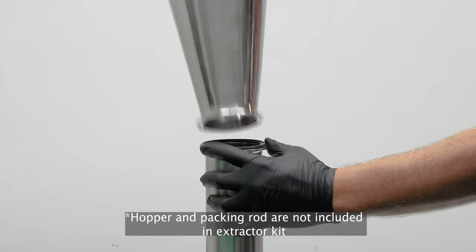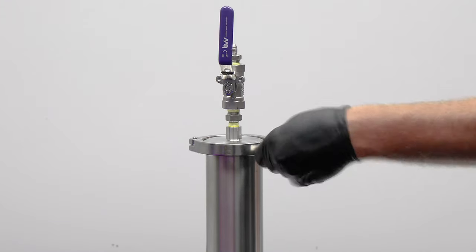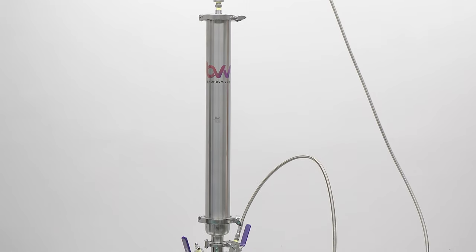Replace the top cap and re-pressure test the system. Go ahead and perform your extraction. That's all for today.